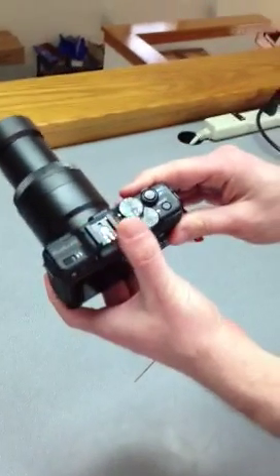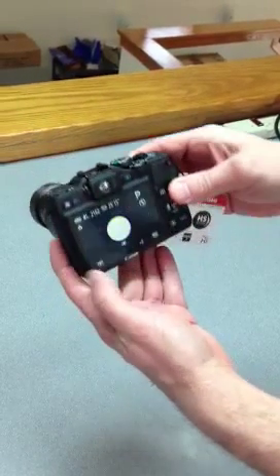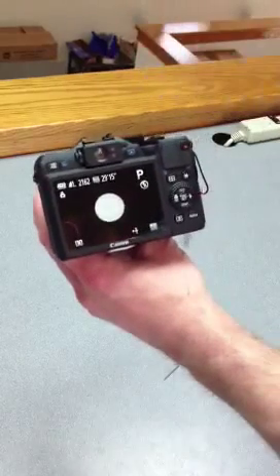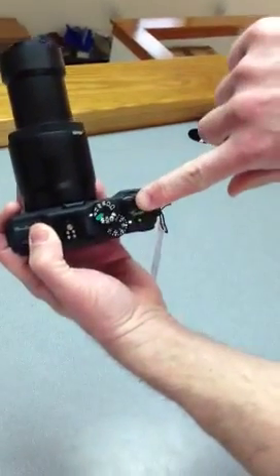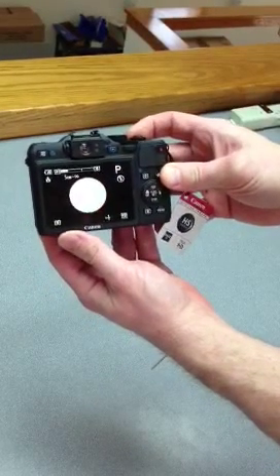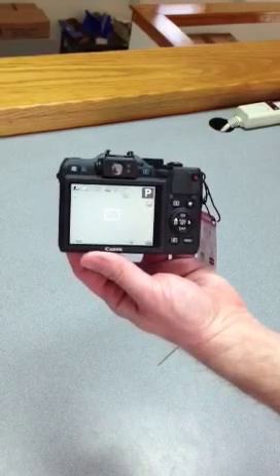To use this, you have an on/off switch right here. The first step is to turn the camera on. It's very important: when you first turn it on, the first step is always to zoom in to the end of the optical zoom. This little button here has a toggle on it — that's your zoom. You can see right now the field isn't filled, so you just zoom in and get a completely filled field of view. Step one is always zoom all the way in.